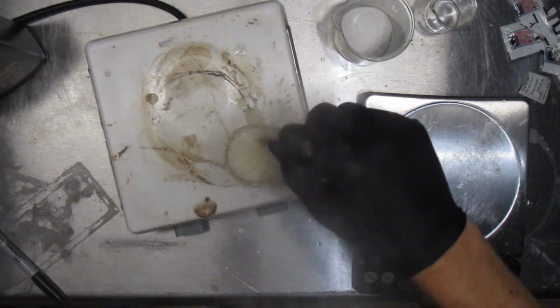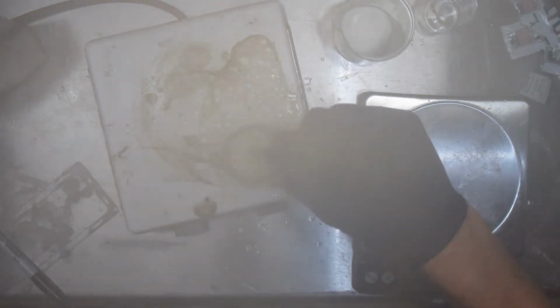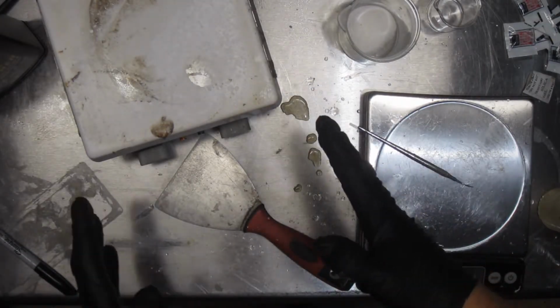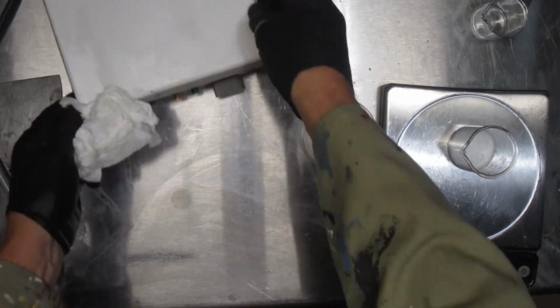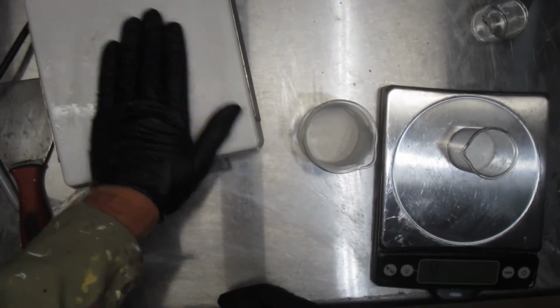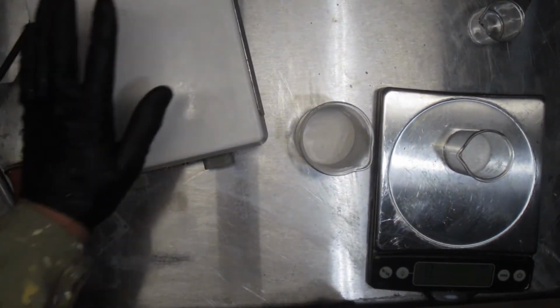Getting tough there, buddy. Too much. Too much at one time. Okay, I'm starting over. Clean this up. We'll go for it again. Okay, we're back. It did a lovely job cleaning up my hot plate, that mess. A little bit difficult to get off, and it was kind of sticky, eh? But not too bad. Anyway, it looks good.